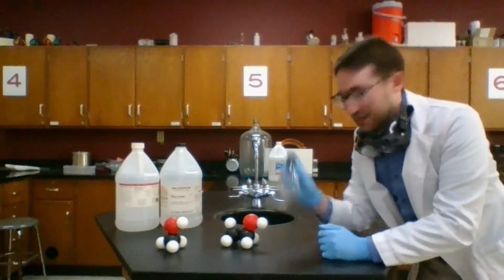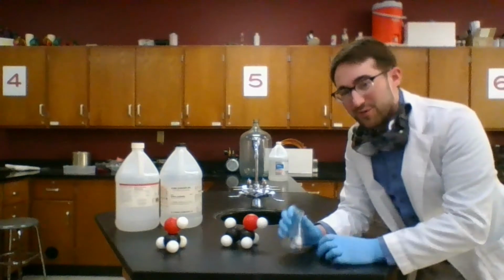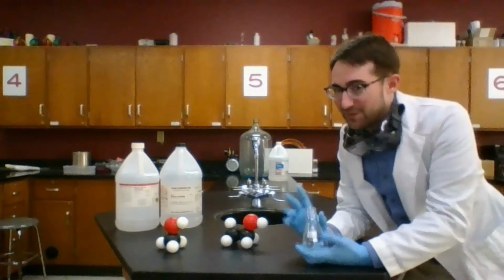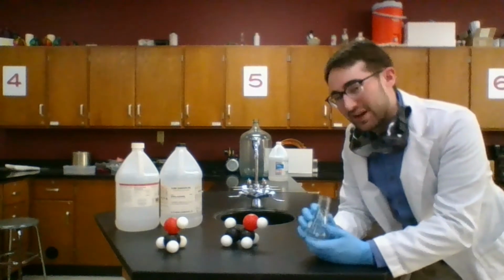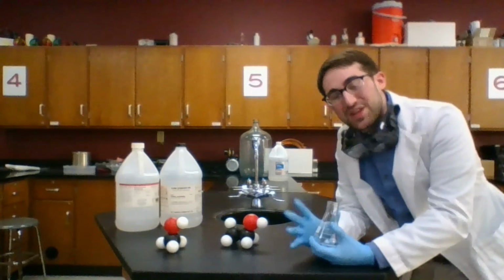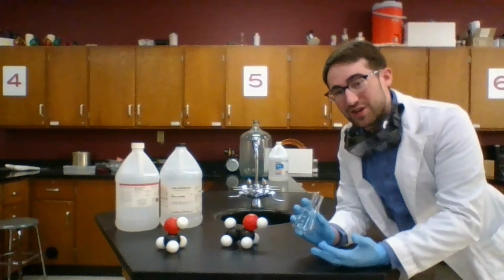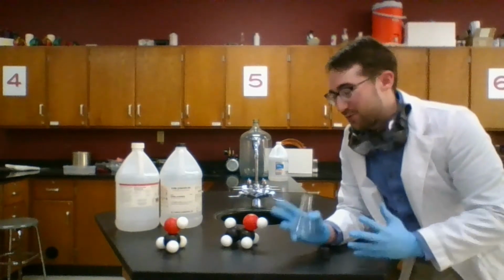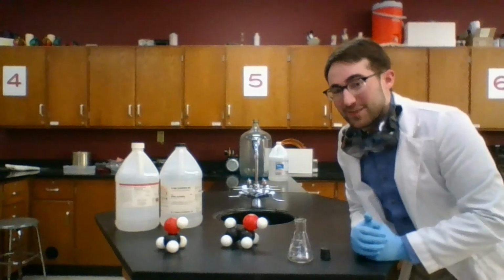We'll have a little bit in a flask like this. We will shake it up to get our ethanol and methanol to vaporize a little bit, and we're going to ignite the gas above the liquid. Right? We should get a combustion reaction, which you might be able to guess, should be some kind of burning. We'll get a flame, right? A release of energy that shows that a chemical reaction is happening, that things are becoming more stable as these chemicals react and turn into something else.